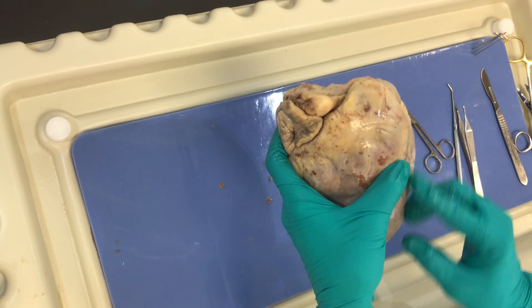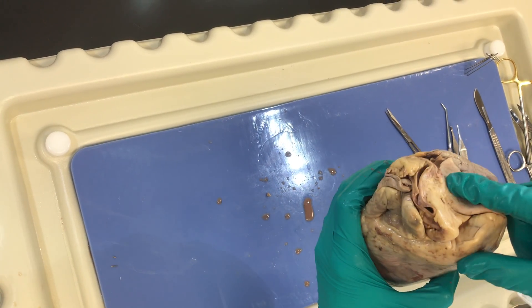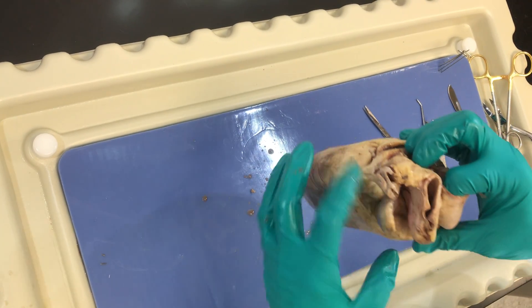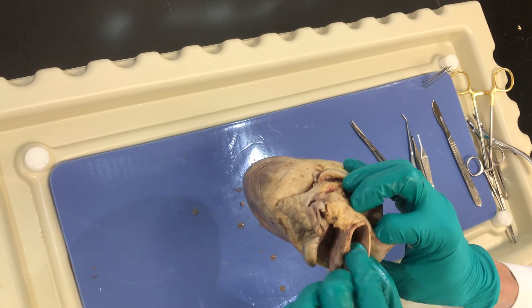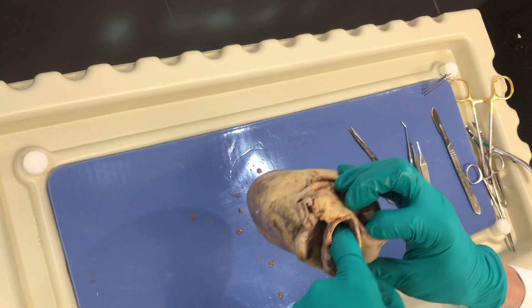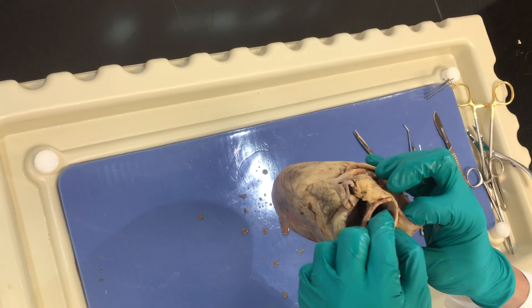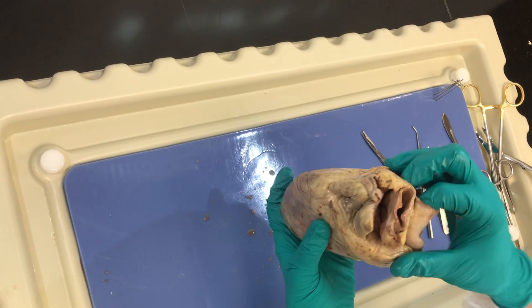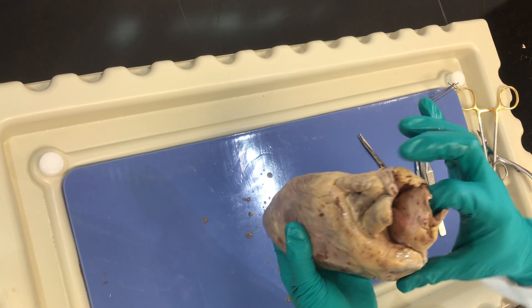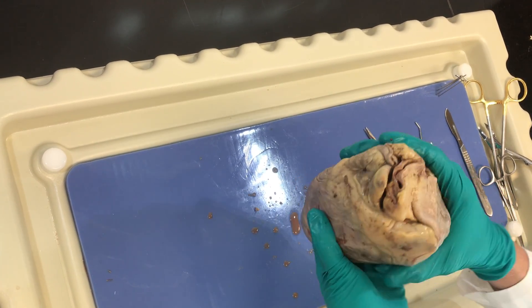Going back to my 90 degrees — here's my left ventricle, right ventricle, and the pulmonic trunk sitting up here. Also important: if you can put your finger in the pulmonic trunk, just posterior to that is a very thickened vessel. This is going to be the outflow from the left ventricle — that is the aorta, the thickest blood vessel in the body. You may have a very small aorta and pulmonary trunk depending on where this was transected in your dissection.